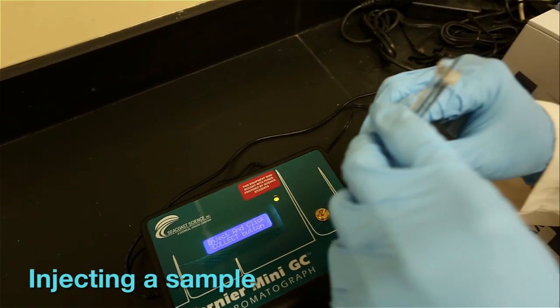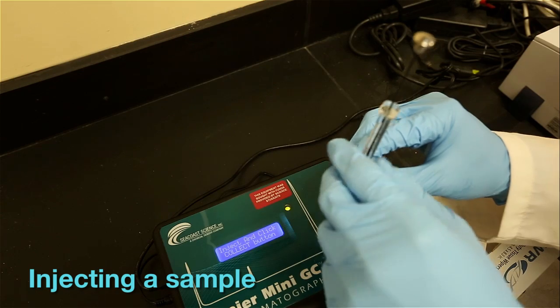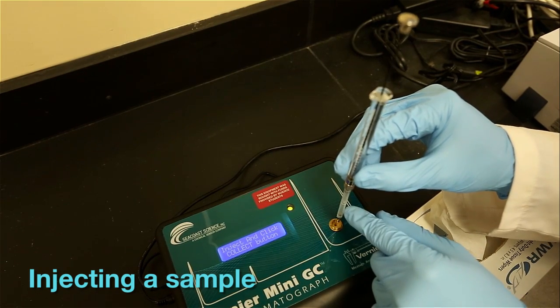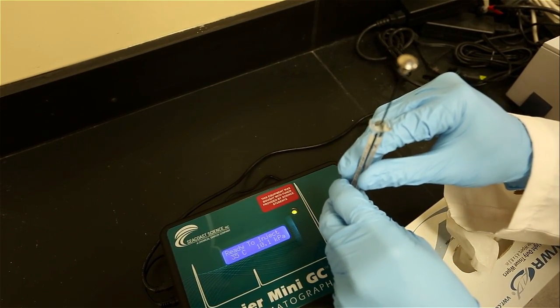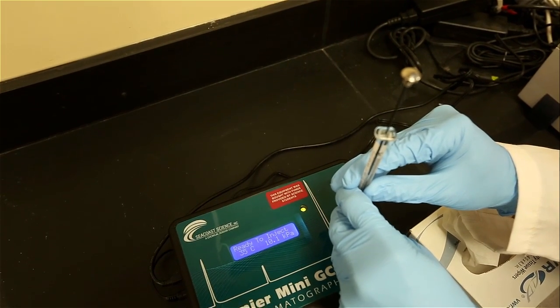Once the program is set to your specified settings, you're ready to inject. Hold the syringe with one hand and steady the needle with another while inserting the needle into the injection port. Do not depress the plunger yet.